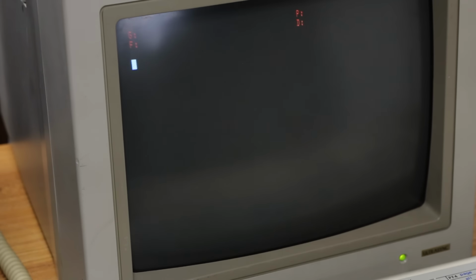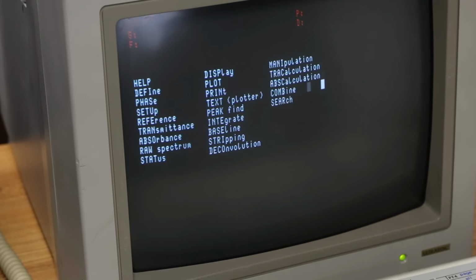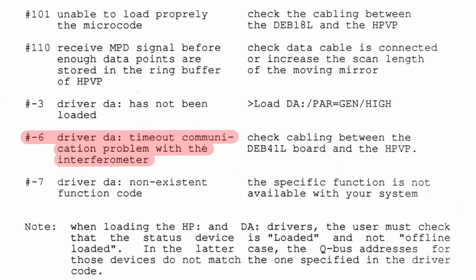And we're gonna load this one up. All right, let's just try this one more time. We'll see if it'll load the microcode in. VP error -6 on send command. If I go into the manual here, let's see, -6 says timeout, communication problem with the interferometer. Check the cabling between the DEB41 and the HPVP.